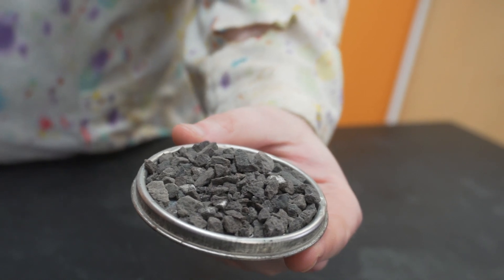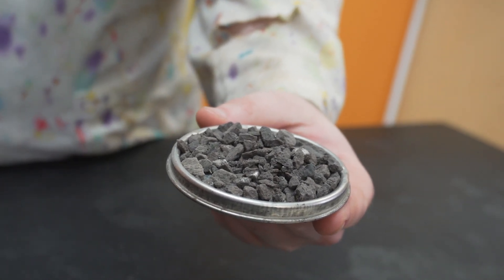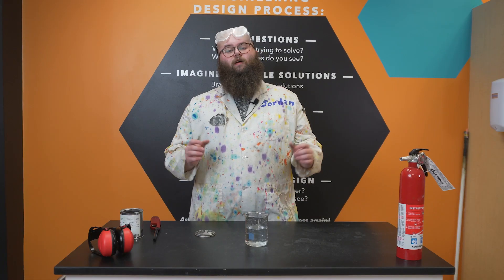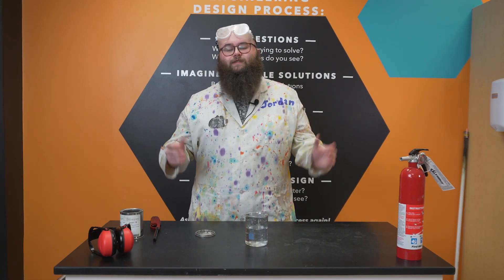Today, however, we'll be using it to study its reaction with another chemical — water. Water is a powerful tool in science, because it reacts with a lot of different things.